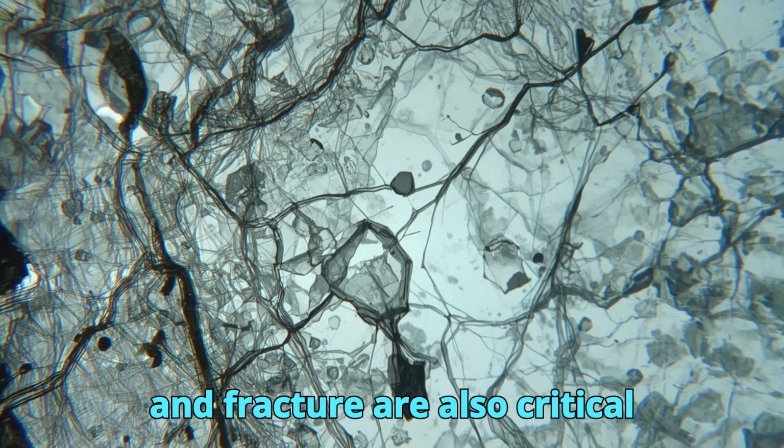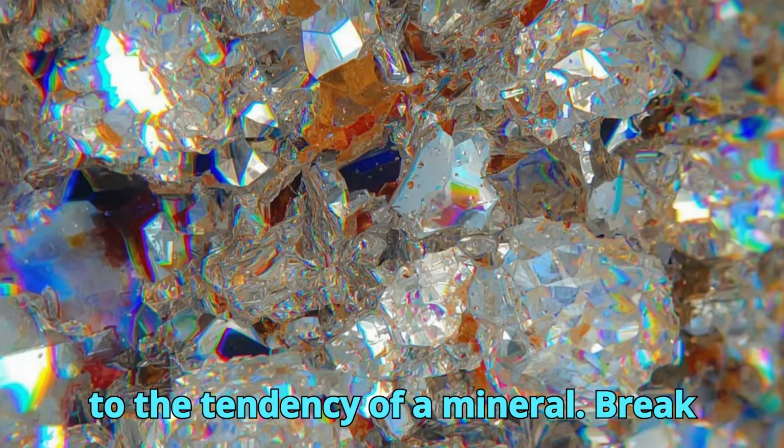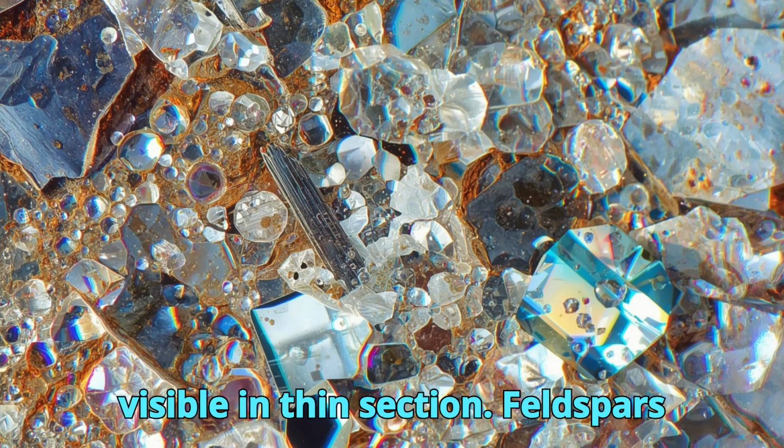Cleavage and fracture are also critical observational features. Cleavage refers to the tendency of a mineral to break along specific crystallographic planes, producing straight, parallel cracks visible in thin section.